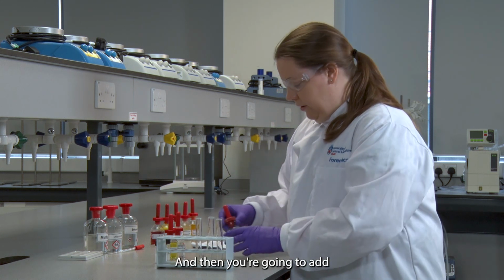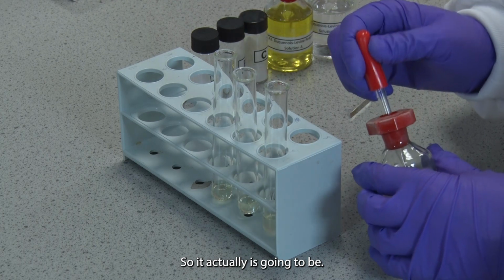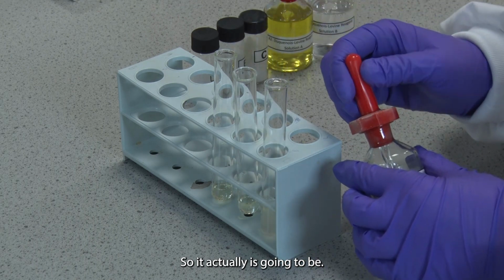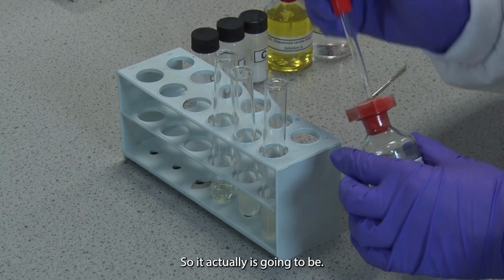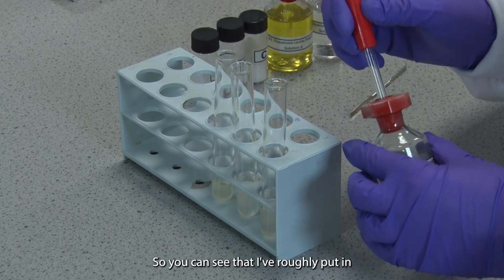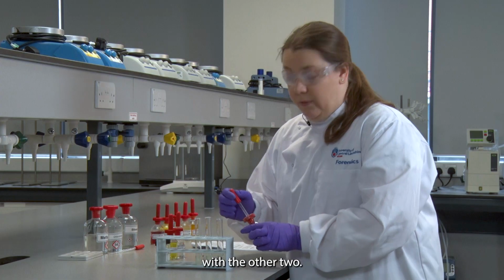And then you're going to add 3 volumes of the last test reagent. So you can see that I've roughly put in about 3 times of this reagent than I have with the other 2.